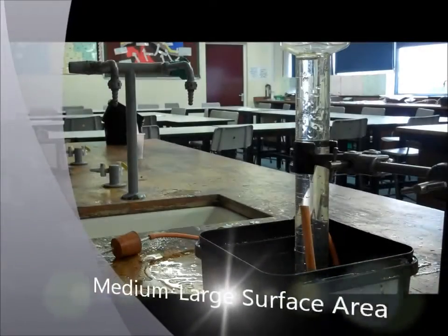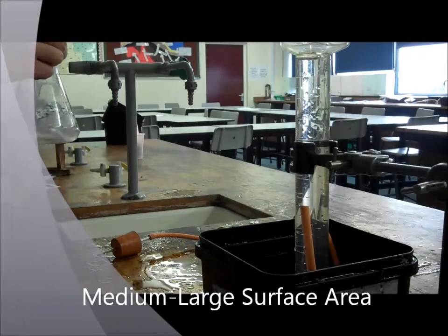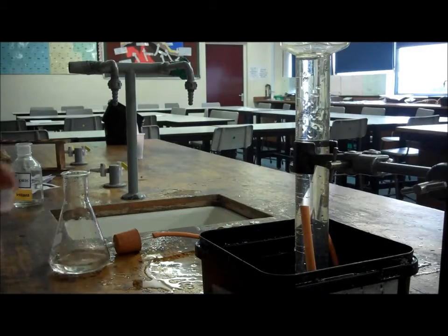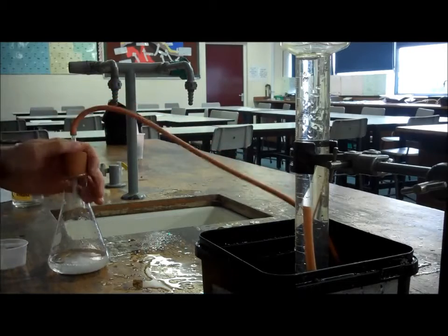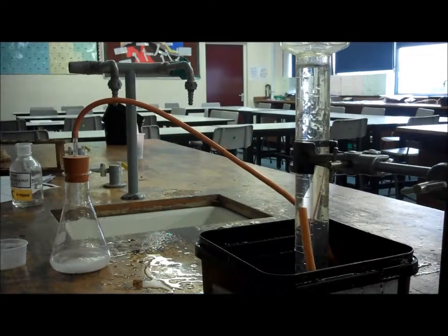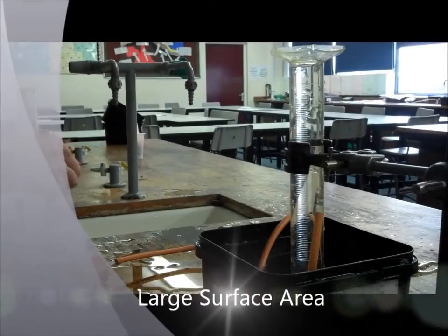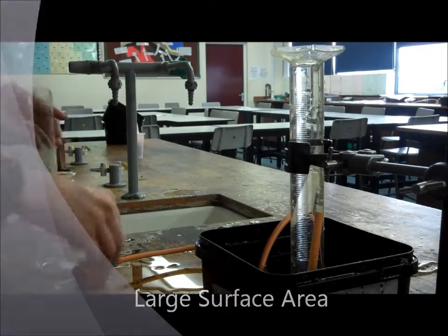The next one are small marble chips, so we've got a medium-sized surface area now, quite large. And finally, the larger surface area, the powder.